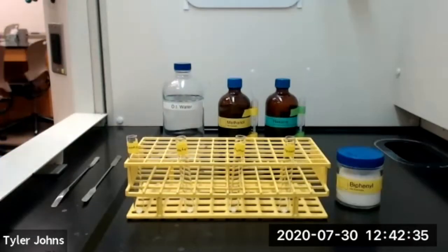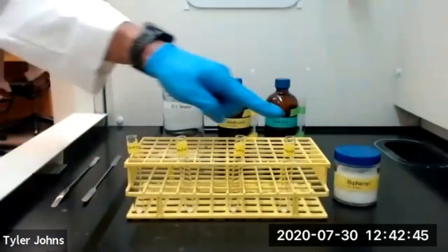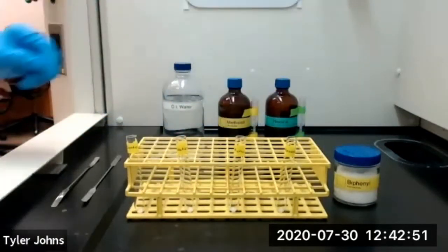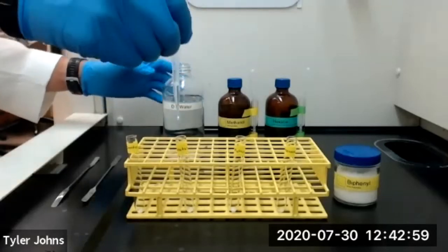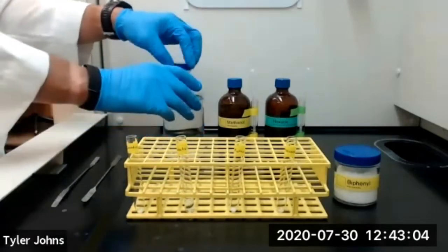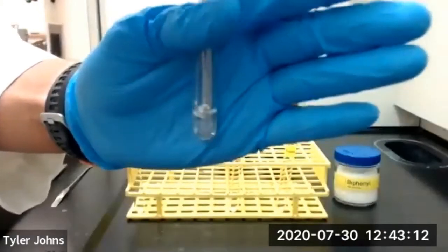We're going to repeat this procedure one last time to investigate the solubility of biphenyl. So we've added 40 milligrams of biphenyl to 4 different test tubes for our control, our water, our methanol, and our hexane. So we'll start with deionized water. We're going to add 1 milliliter of deionized water to our 40 milligrams of biphenyl. Then we're going to twirl a microspatula inside of our test tube for 60 seconds.